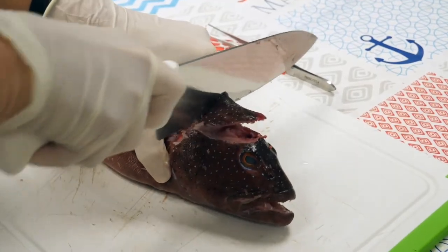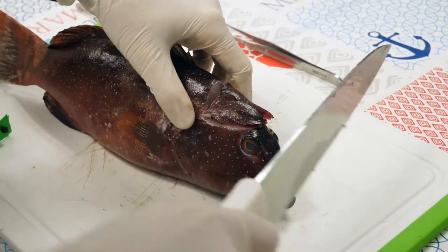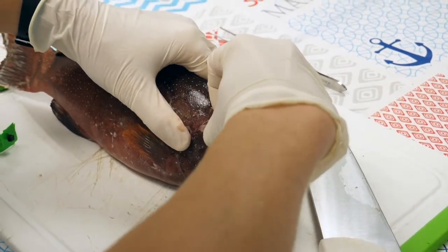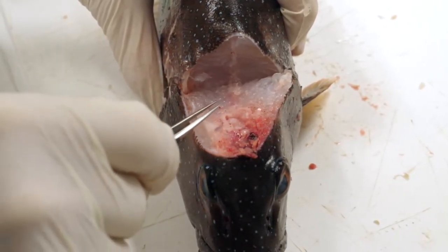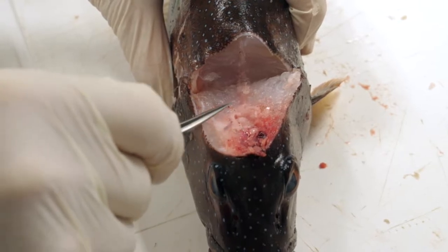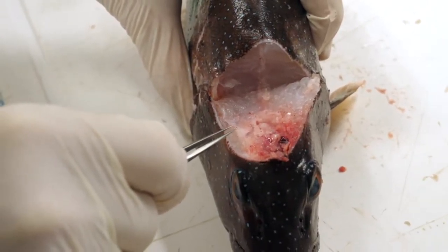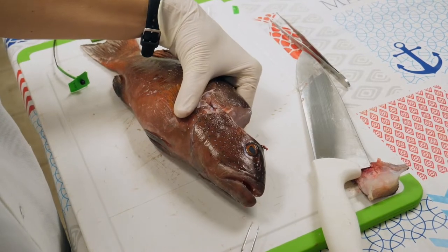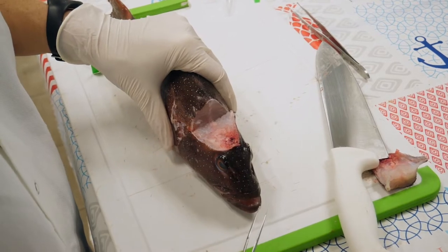It's a good idea to move away or cut the piece of flesh attached to the fish so that it does not obstruct your view. The fish cranium is now accessible. The cranium should be open and the brain should be visible. If it is not, cut the cranium so that the brain becomes visible. Position the fish so that its ventral side faces the work surface and the dorsal side faces you.